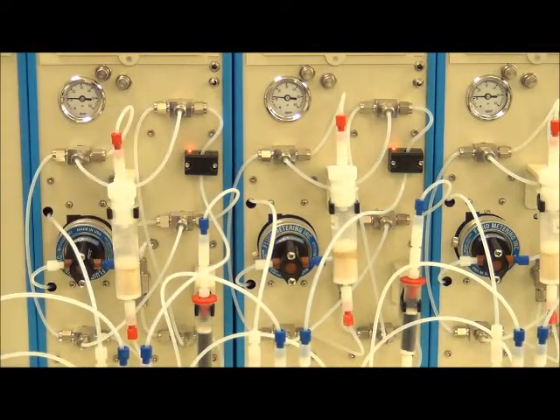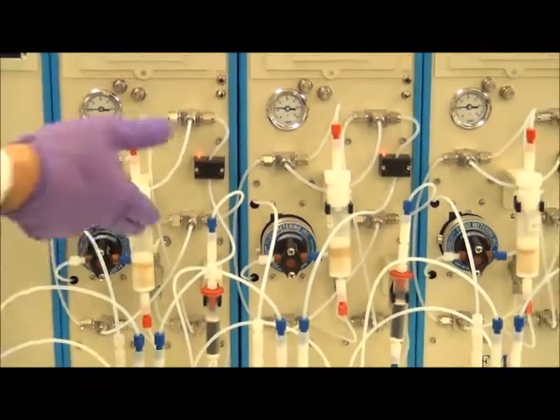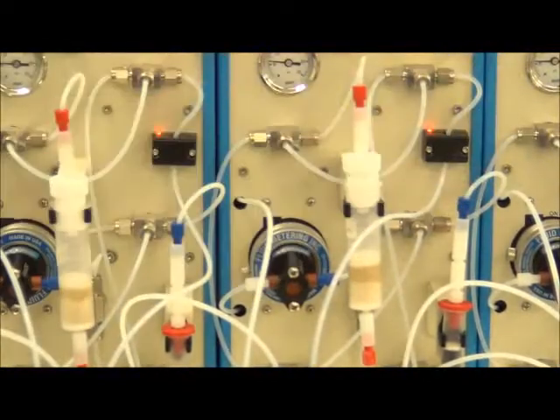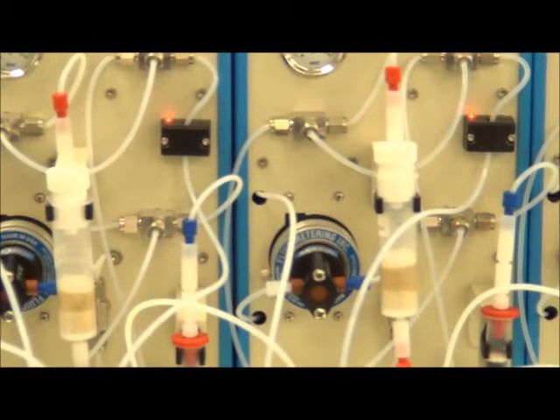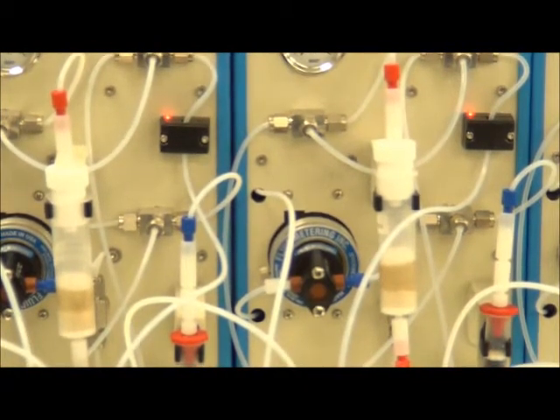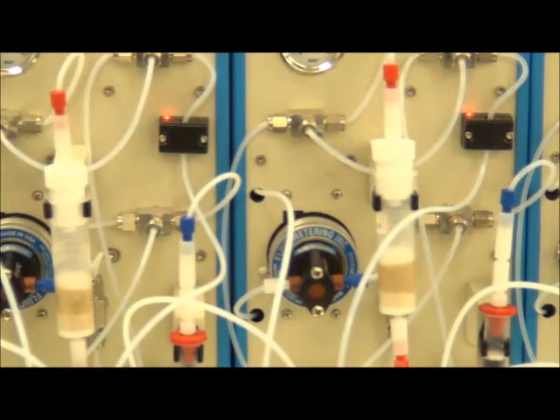See now as the methylene chloride starts to wet the cartridges, you can see the mixed bed cartridges beginning to wet. In this step it will apply 10 mL of methylene chloride to each cartridge just as a pre-wetting cleaning step. You can see each mixed bed cartridge is fitted with a pre-filtration device in order to keep particulate matter from clogging the cartridge.